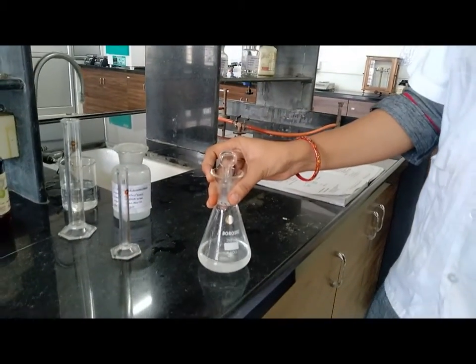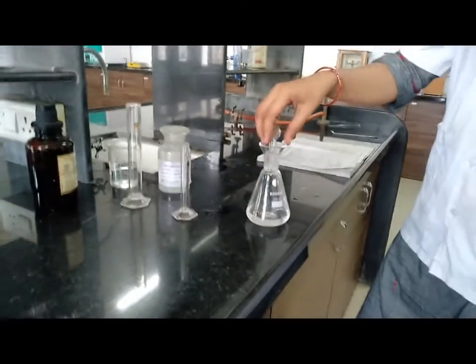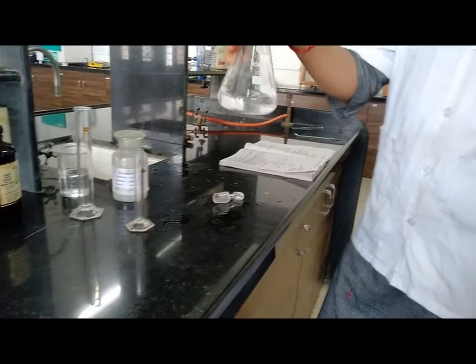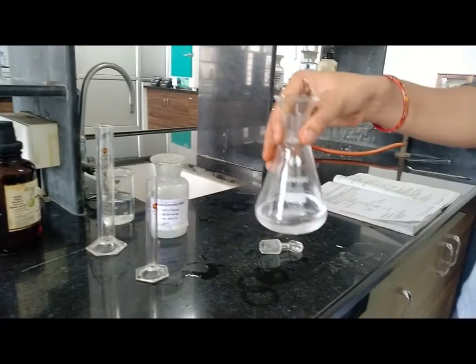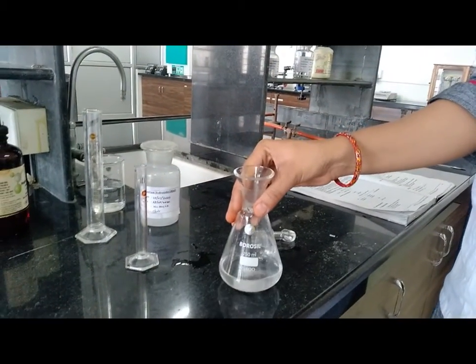After 15-20 minutes we get white color crystalline powder precipitate. Now collect this product on funnel at vacuum pump.